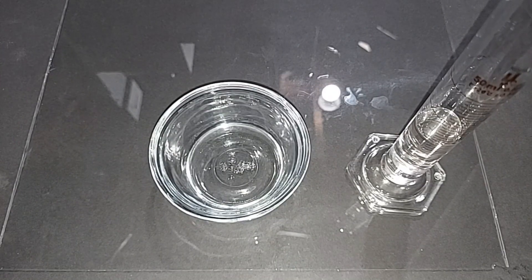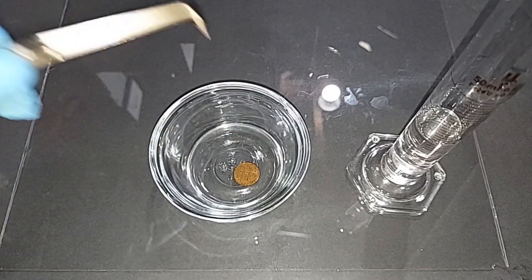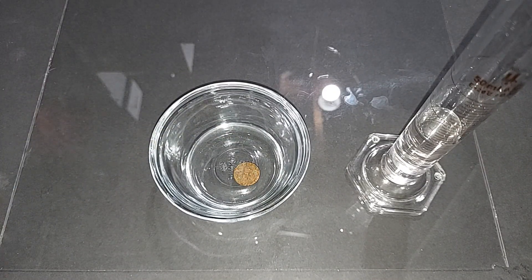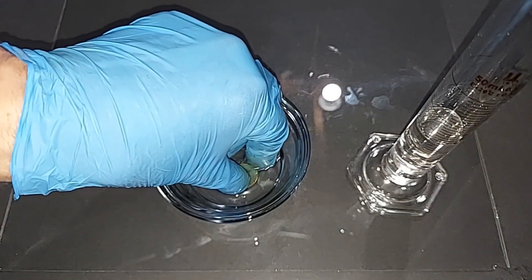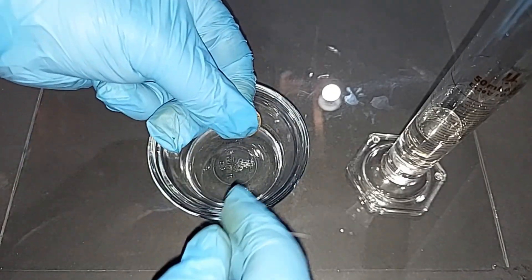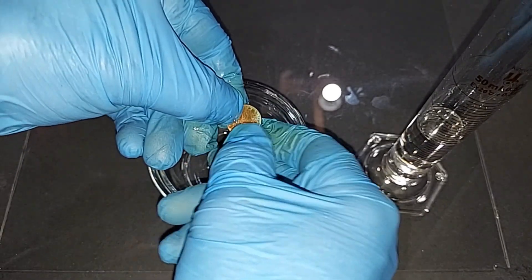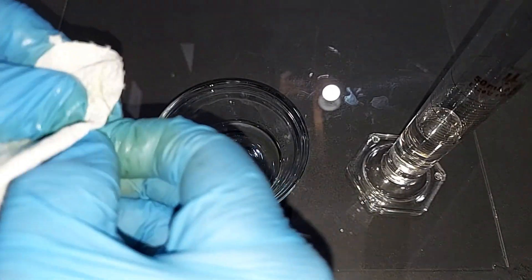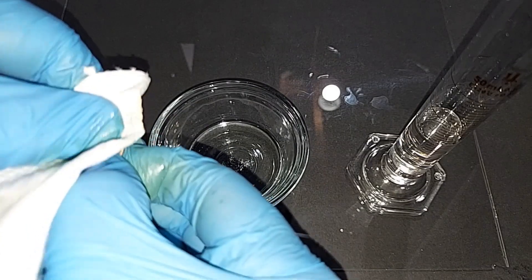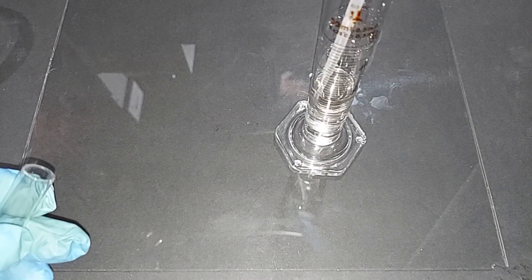I poured just under half of what's left into the shallow dish again, this time placing a dirty penny in it. Vinegar cleans dirty pennies nicely — let's see if this more concentrated acid does it faster. After about 12 or 13 minutes, it turned a really dark green color. The acetic acid reacted with what's on the surface of the coin. I'll tell you, every once in a while the acetic acid fumes reach my nose and it's potent. In vinegar this cleaning takes a lot longer.